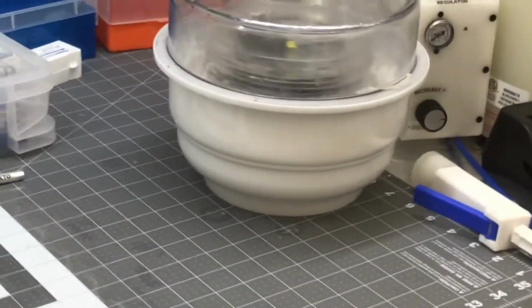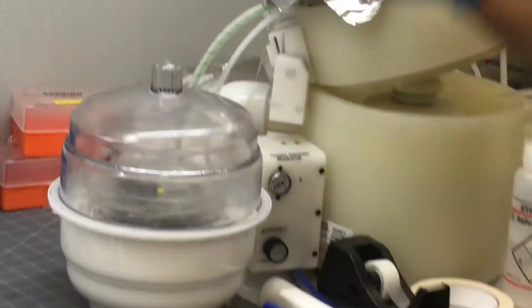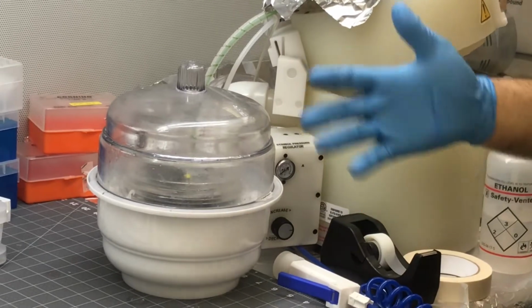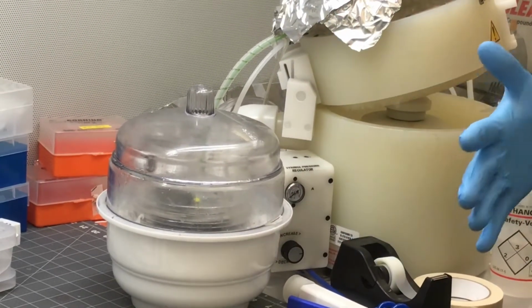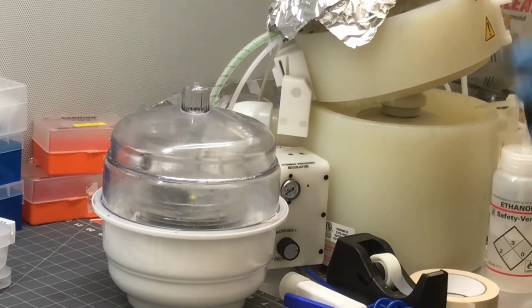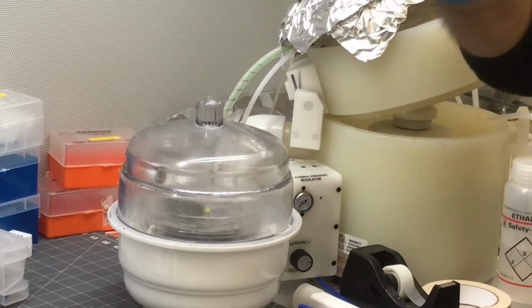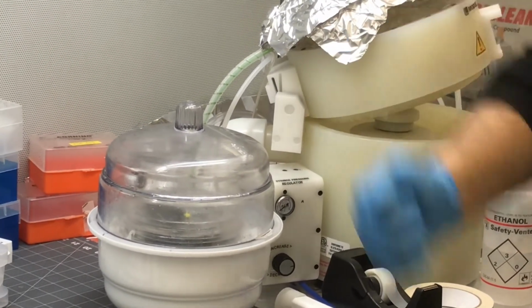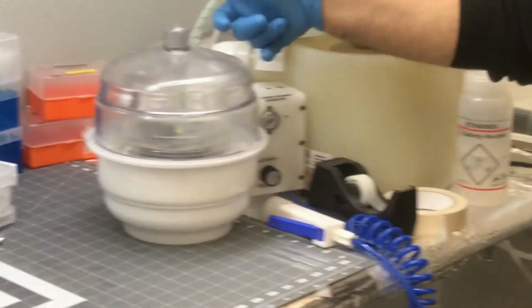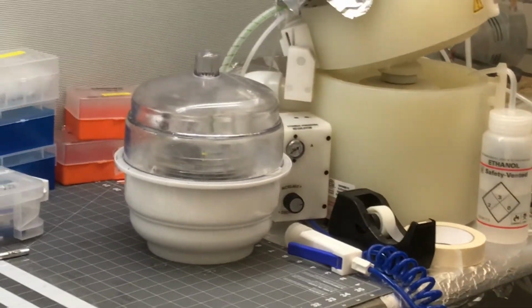Can you explain what is going to happen if bubbles remain inside the chip? Yeah, if bubbles remain inside the chip, when you add any solution, this bubble finally needs to go out. And the PDMS is not completely solid. It is kind of semi-solid, not a very hard material. So those bubbles attach to the surface of your cover slip, and when you add the solution, the solution does not pass through the channel. For this reason, your chip should be completely bubble free. So that means there should not be any entrapped air. Exactly, entrapped.